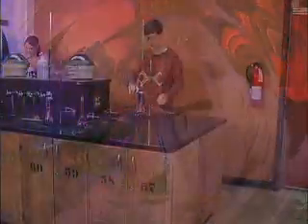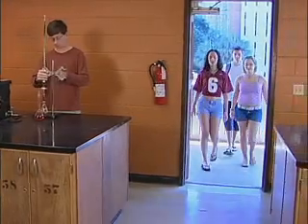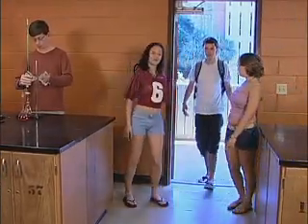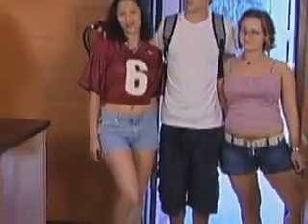Well, he got what he deserved. Let me remember. Rule number 5. No matter how cool you are, appropriate attire must be worn in the lab, including shoes that cover the entire foot and clothing to cover legs and torsos.